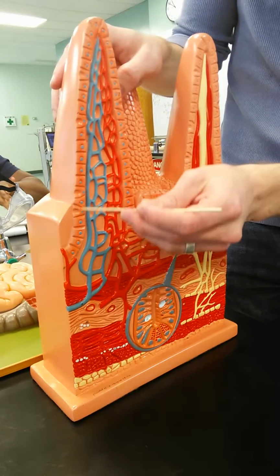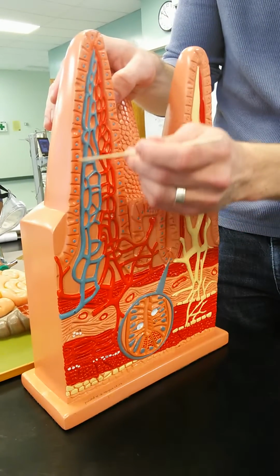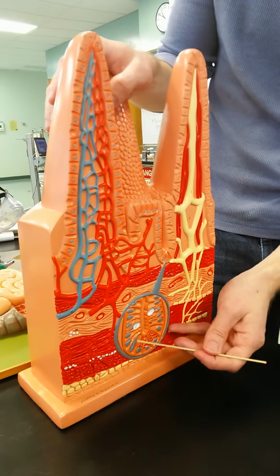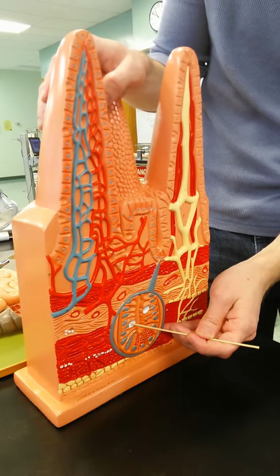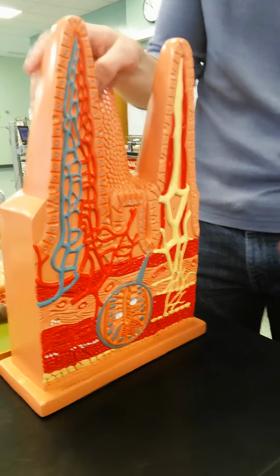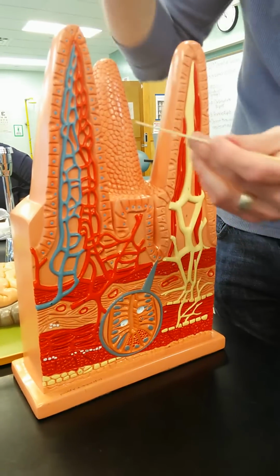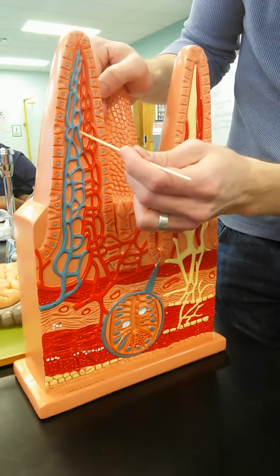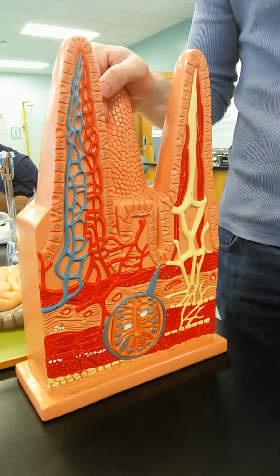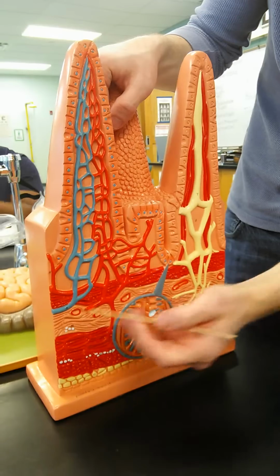We have our epithelial cells. We're starting out with the mucosa, right? So epithelium, which is the simple columnar epithelium, and where this is blown up right here, you can actually see the other kind of cell, the goblet cells, which are responsible for secreting mucus. As we move away from the lumen outward, we have the pink areas in here. That's the lamina propria, the thin areolar connective tissue layer.